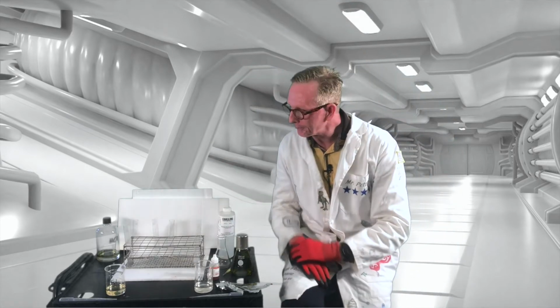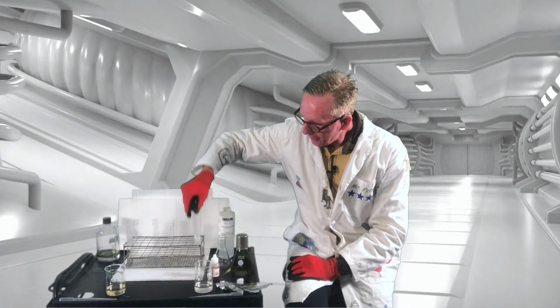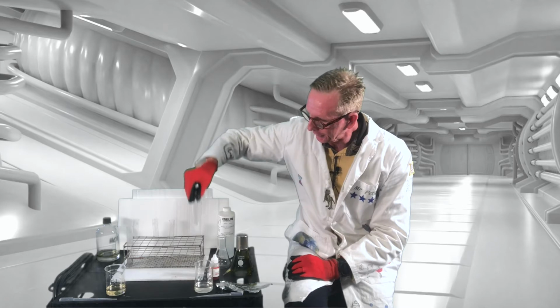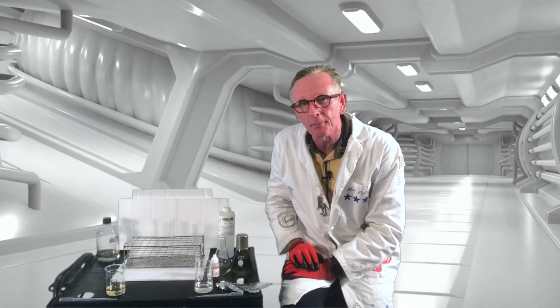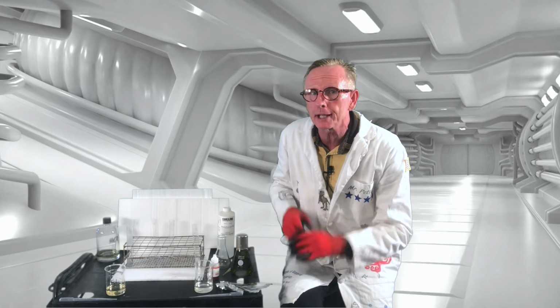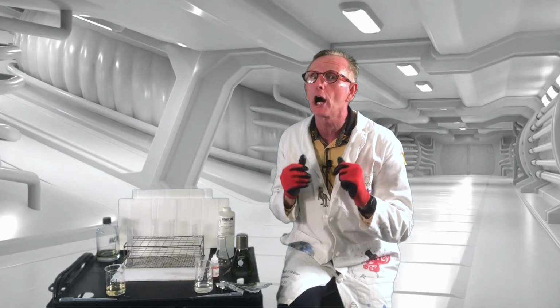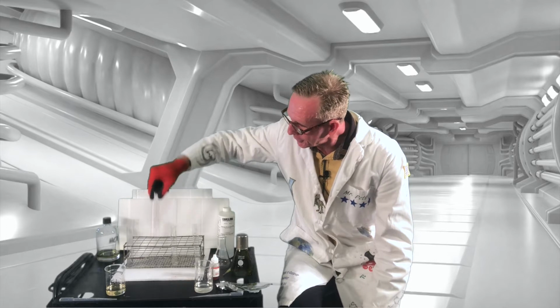All right, so hydrochloric acid worked a little faster on the aluminum than did the sodium hydroxide, but the sodium hydroxide is still eating away and dissolving the aluminum. We'll take a look at them at the end of the lab, but just to show you the effect of either of these. Either of these tossed out into a waste site or dumped into the ground, etc., can obviously cause problems for human beings or other living organisms. So let's move on to the rest of it.